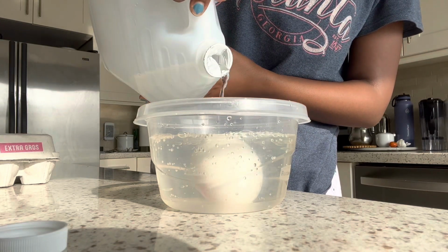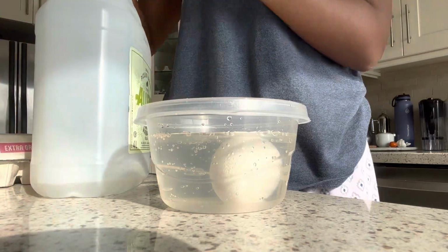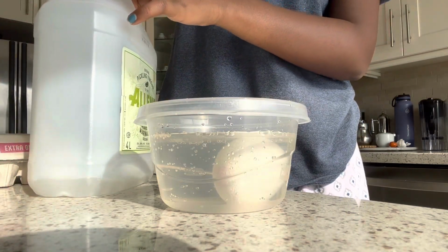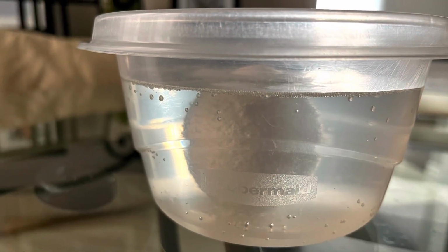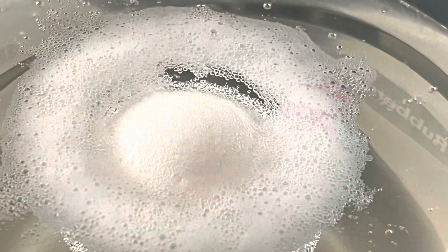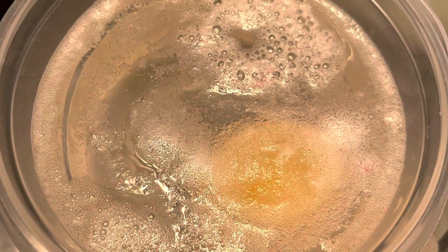I started by taking a container that would fit Egna and filling it with vinegar until Egna was fully covered. I did this at 10 a.m. on the weekend, which led to a small error in my experiment. The next day, when I was supposed to replace the vinegar after 24 hours, I couldn't, because I would have been at school at 10 a.m. So I replaced Egna's vinegar after only 21 hours.